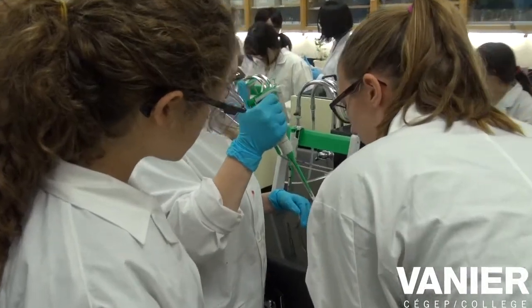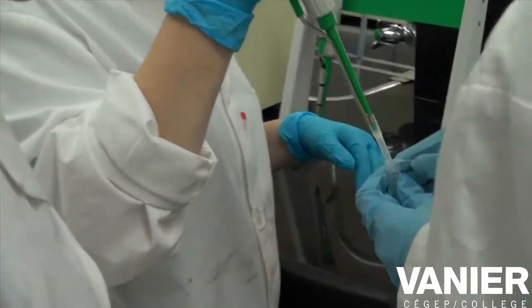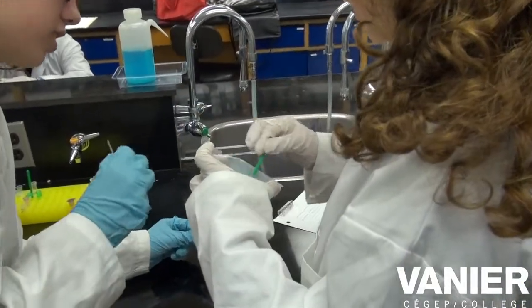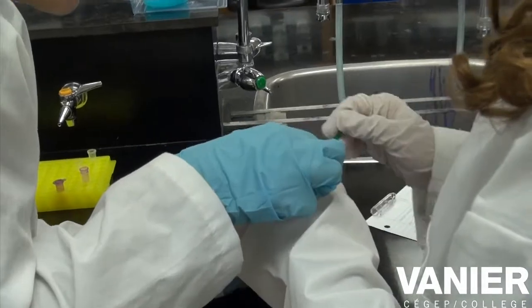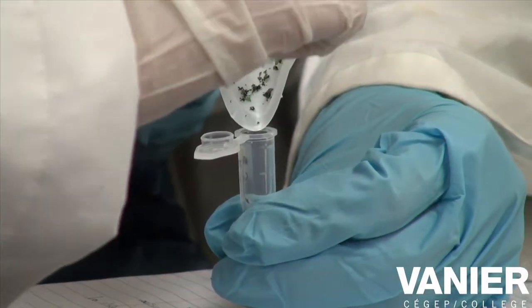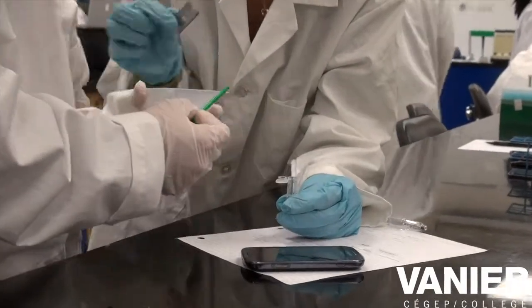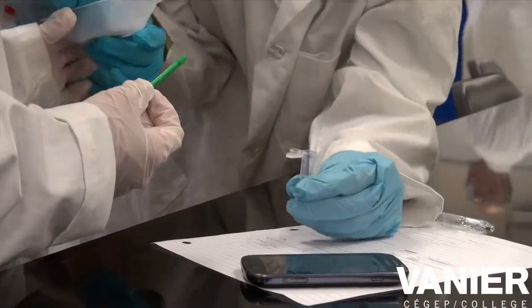They're still a little dark. Yeah. If you want to test the liquid — okay. You want to start scraping? In here, you add 200 microliters along the lysis buffer, and you grind it. It's okay if you lose small pieces of the leaf.